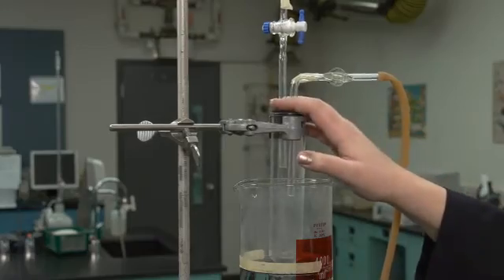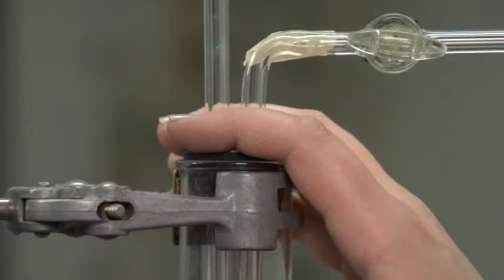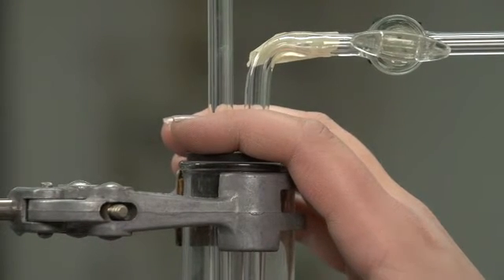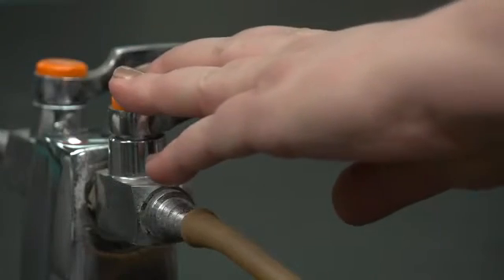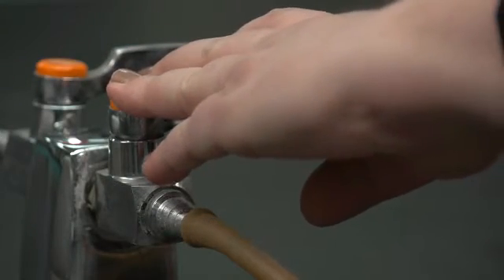Hold the stopper in place at the top of the apparatus to prevent it from flying off if the gas pressure is too high. Very slowly, partially open the valve to the gas source.